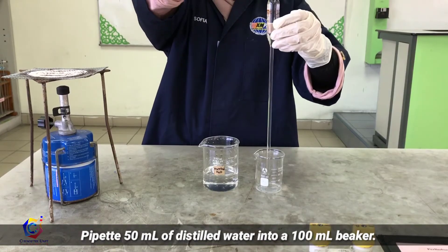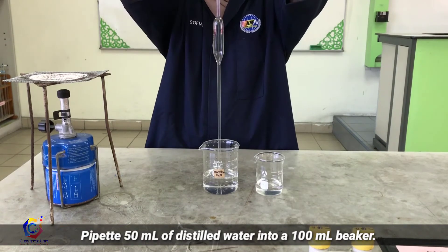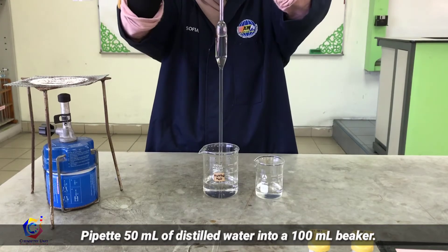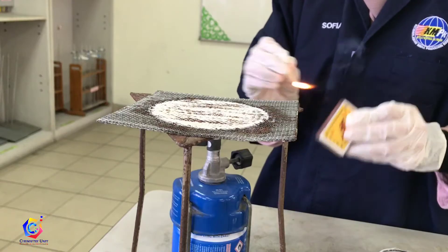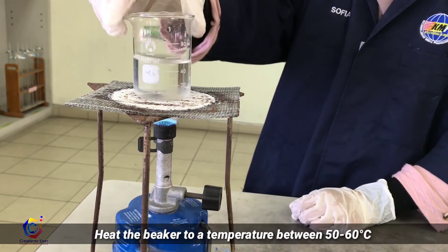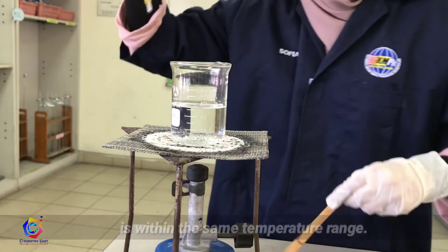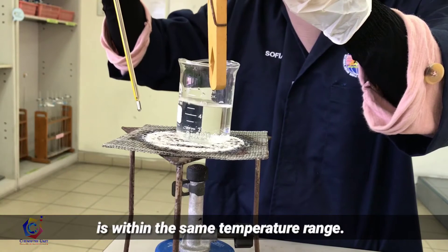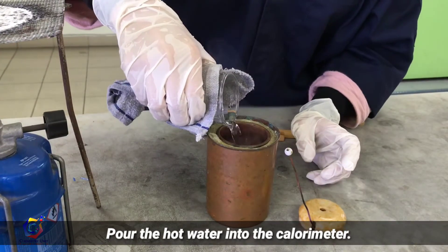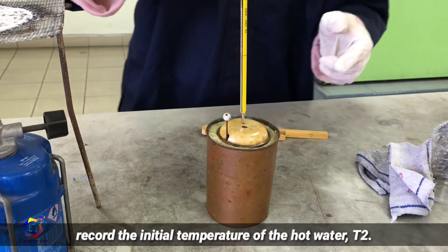Pipette 50 ml of distilled water into a 100 ml beaker. Next, heat the beaker to a temperature between 50 to 60 degrees Celsius. Check that the temperature of the water is within the same temperature range. Pour the hot water into the calorimeter and close the lid immediately, and quickly record the initial temperature of the hot water — that is T2.